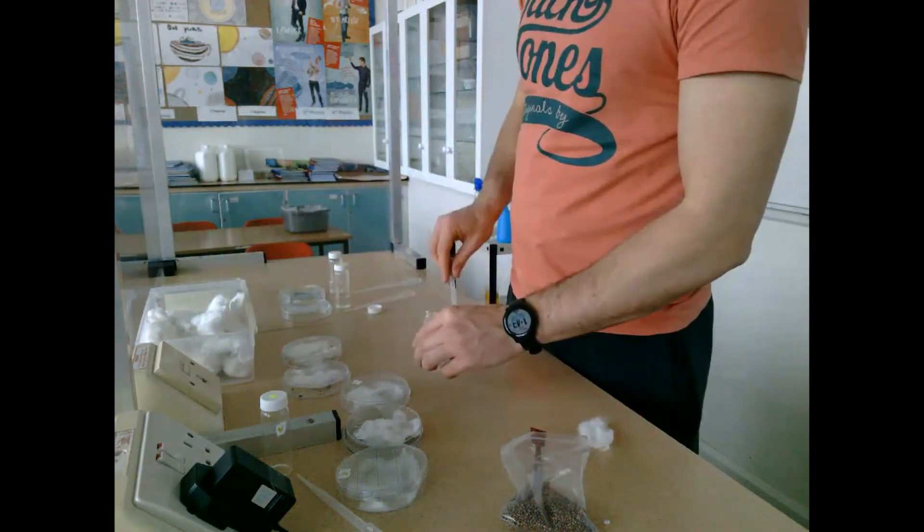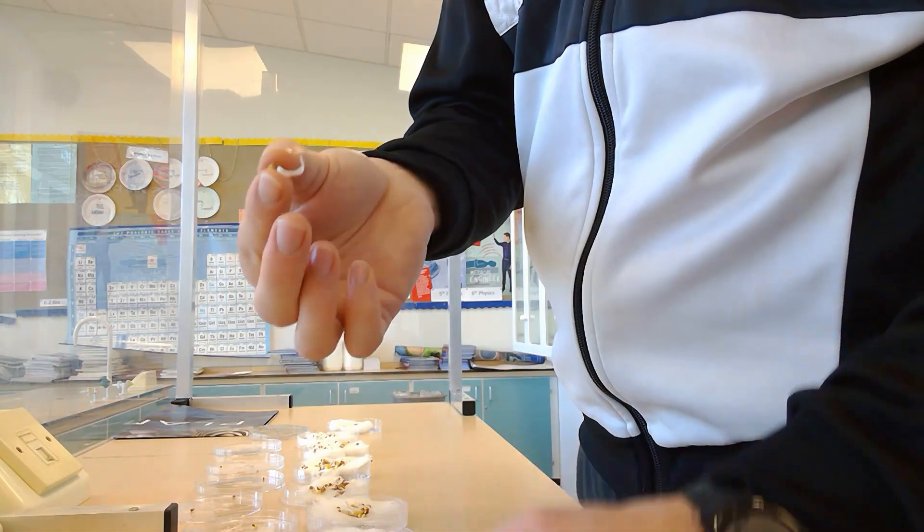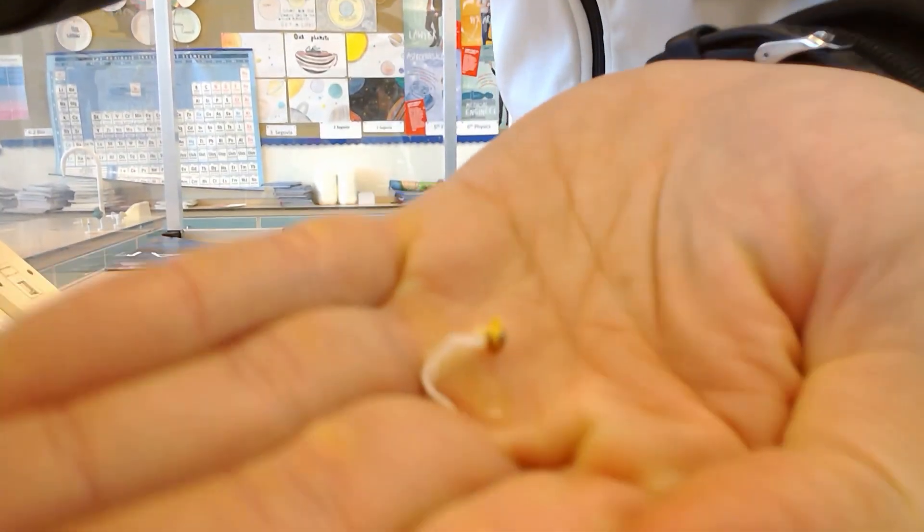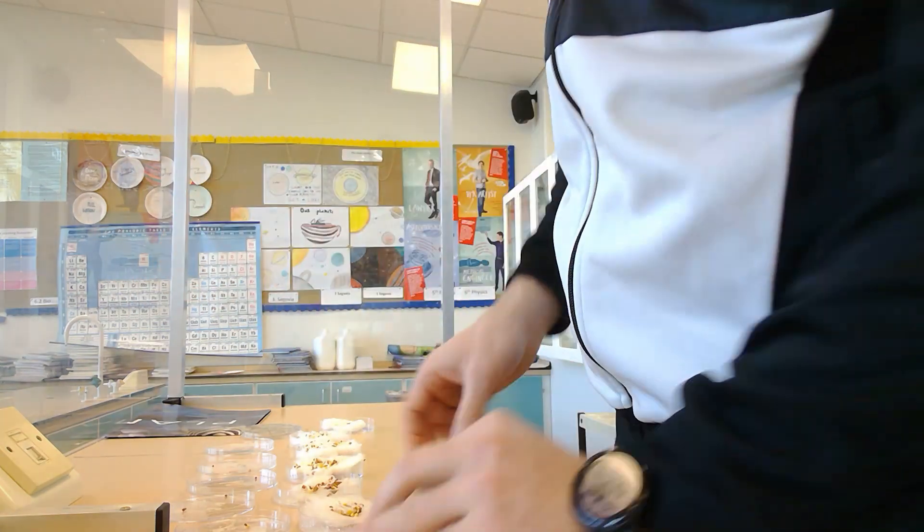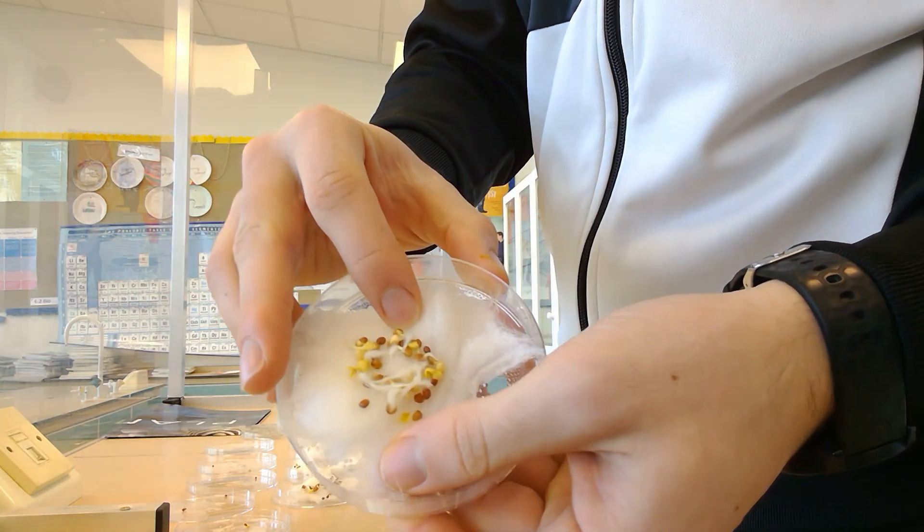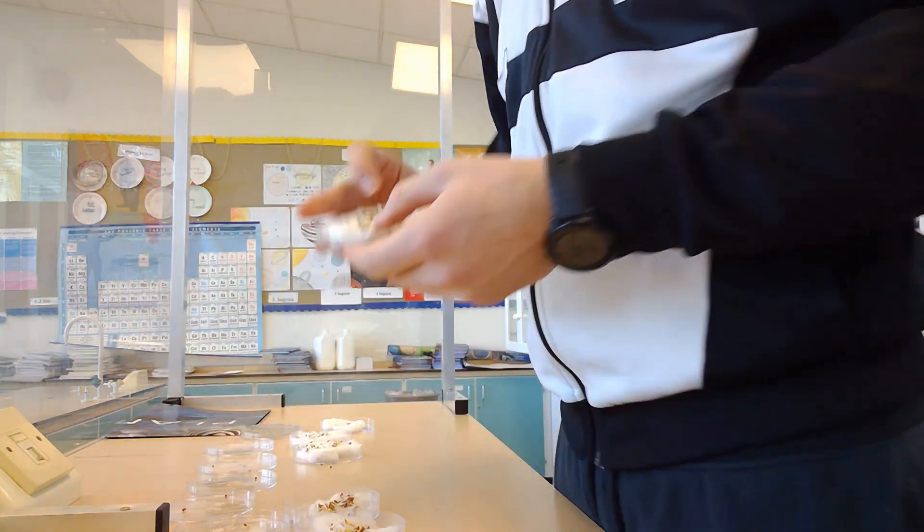After three to four days, I went back and took these petri dishes out of the incubator and noted the growth within each plate. This experiment's really hard to run and get correct, but you can see there clearly that the radicle had developed out of one of these radish seeds, so I'm not overly concerned about what the actual results were.